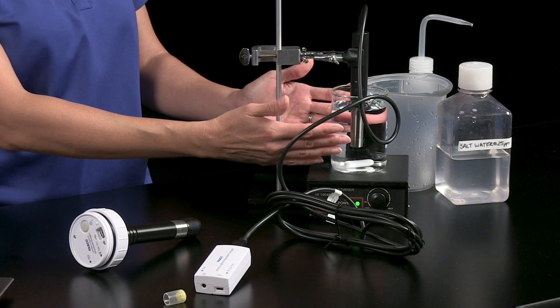But first, let's talk about sensor use and care while we wait for the sensor to come to temperature equilibrium with the water sample to get the most accurate measurement. Calibration is not required, but if you would like to calibrate your sensor against a standard, PASCO software allows you to calibrate through the dissolved oxygen saturation measurement. For calibration steps, visit the help system for your PASCO software program.